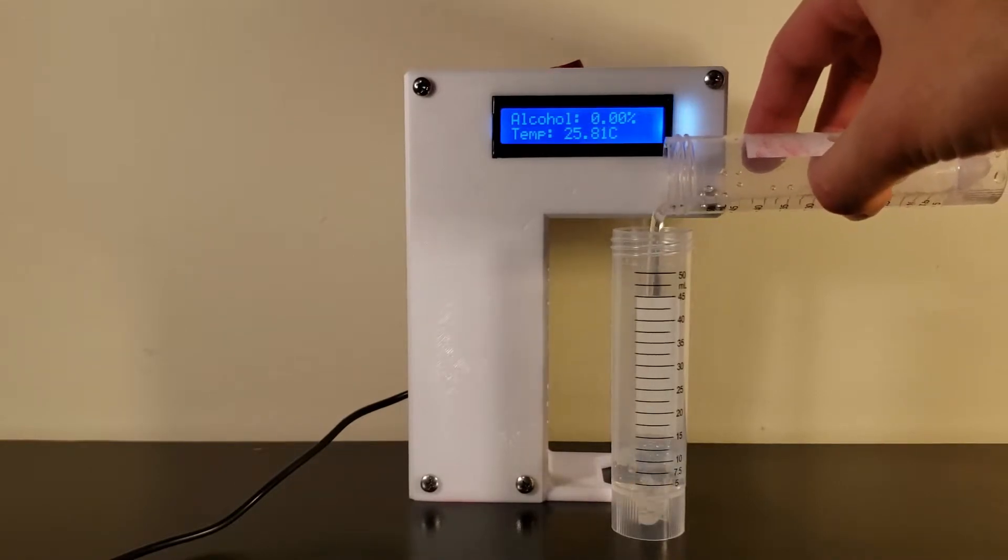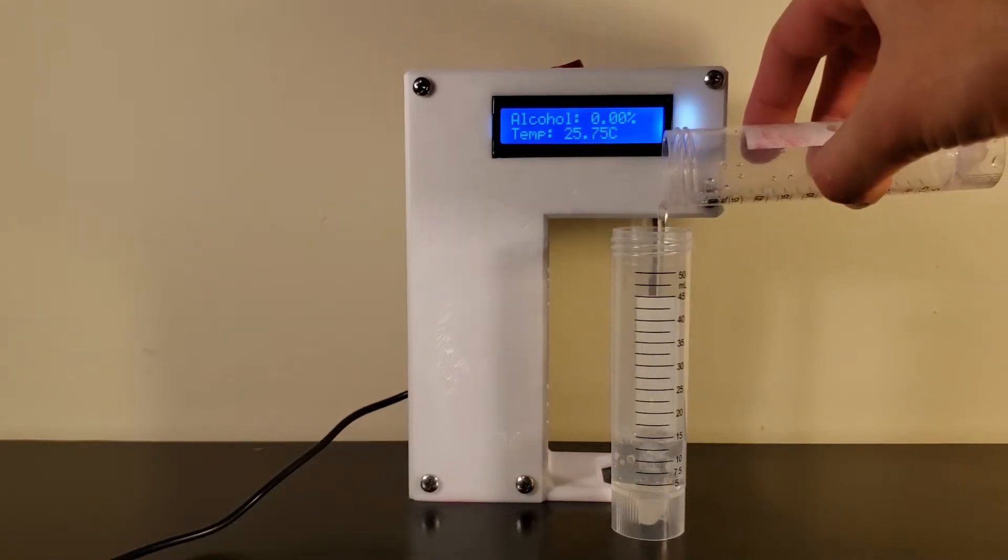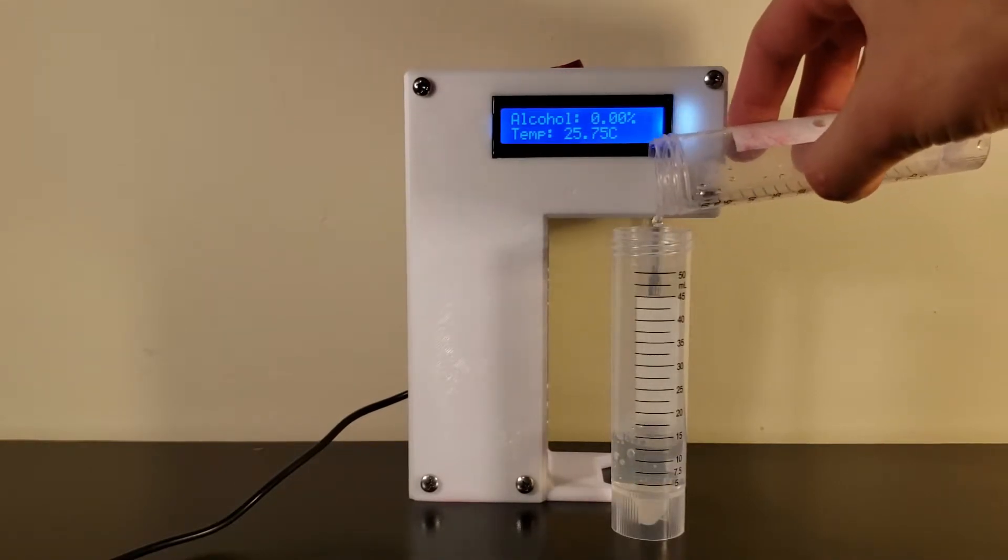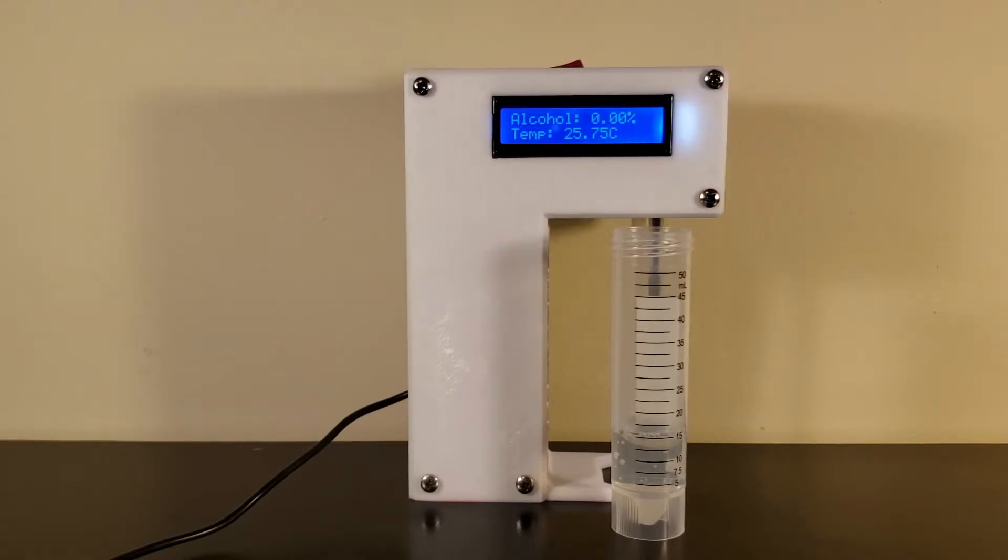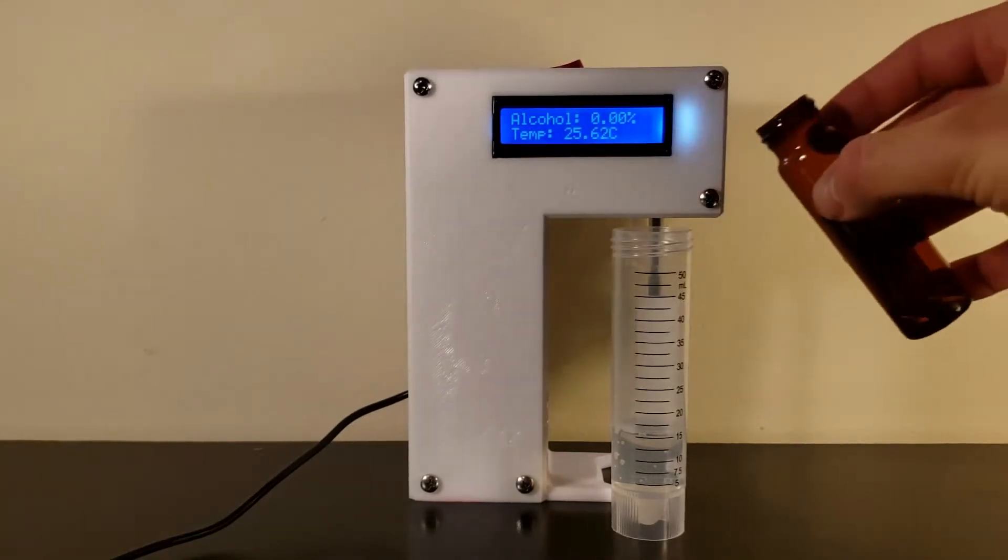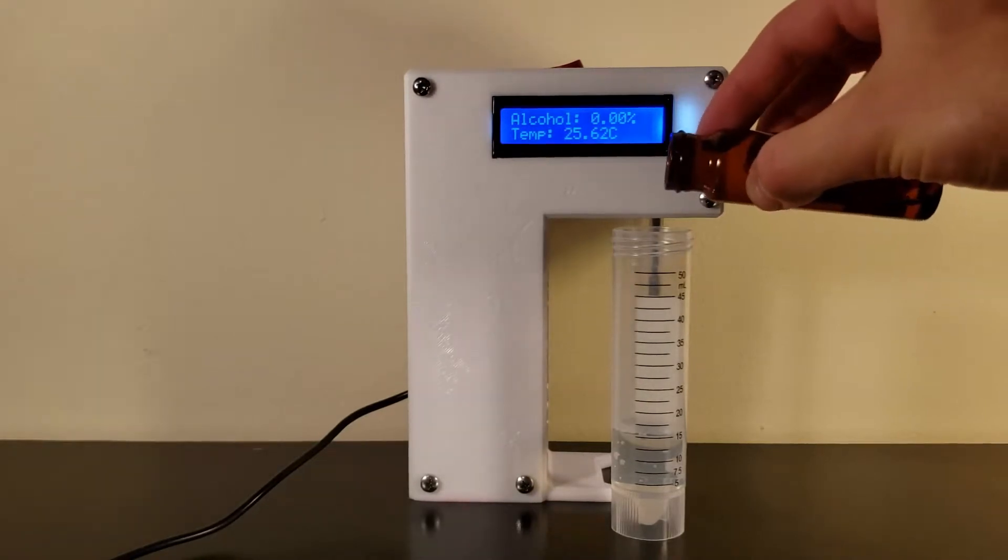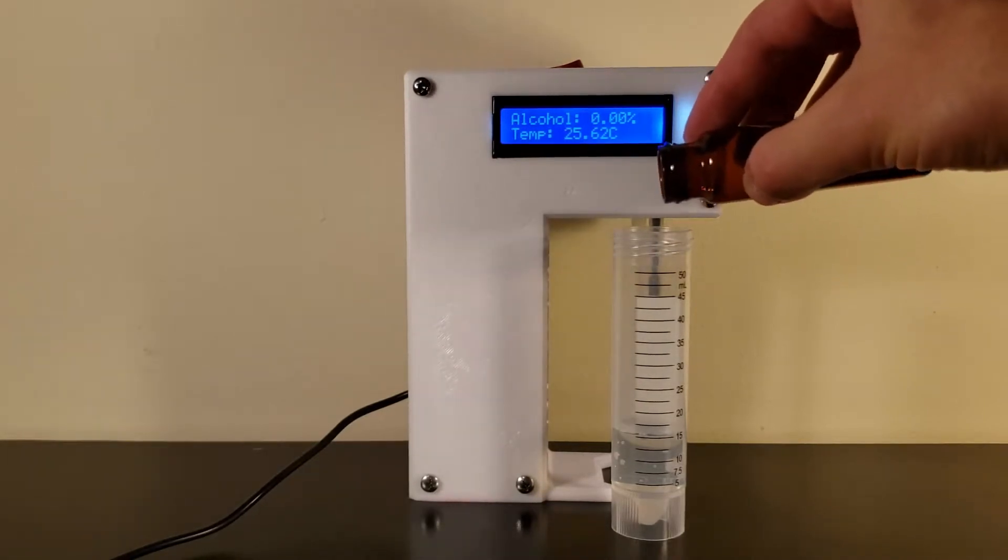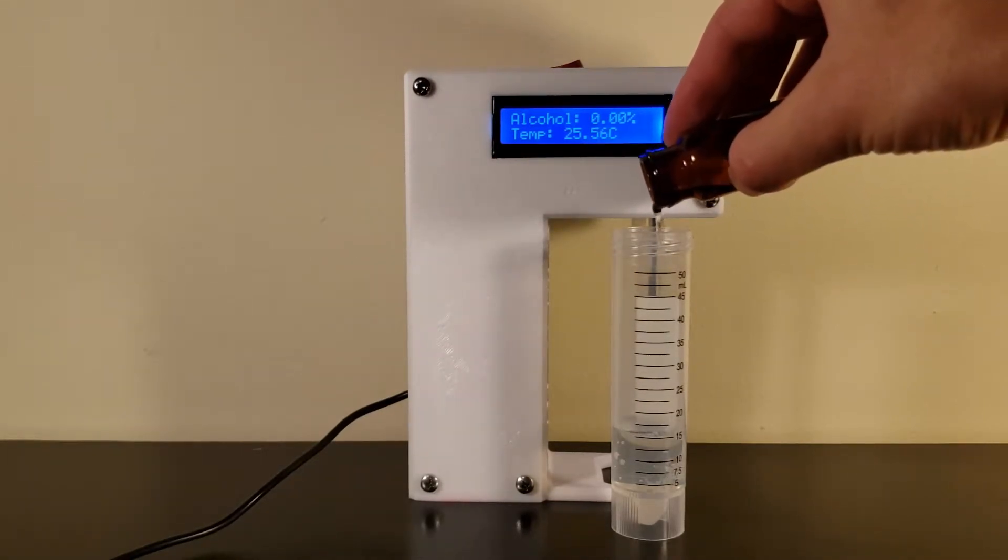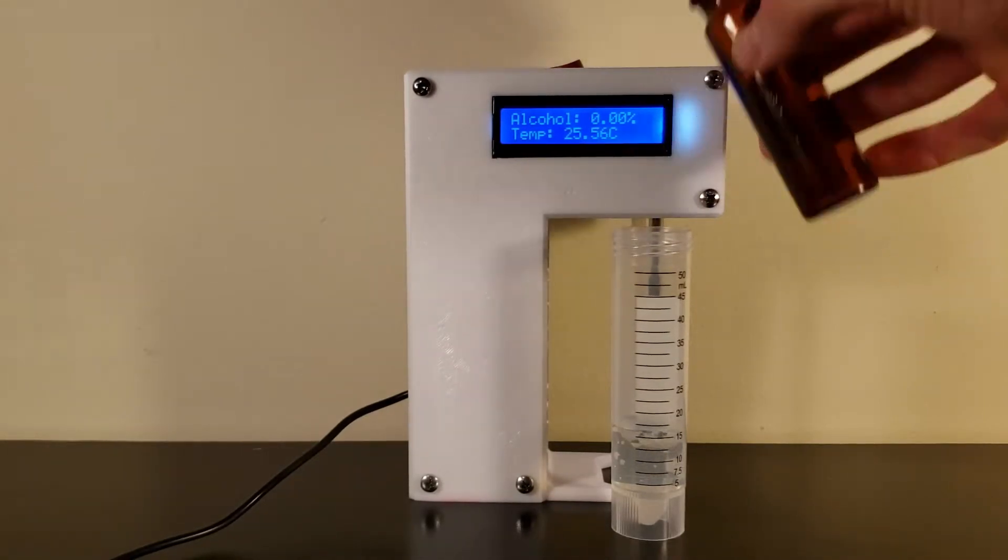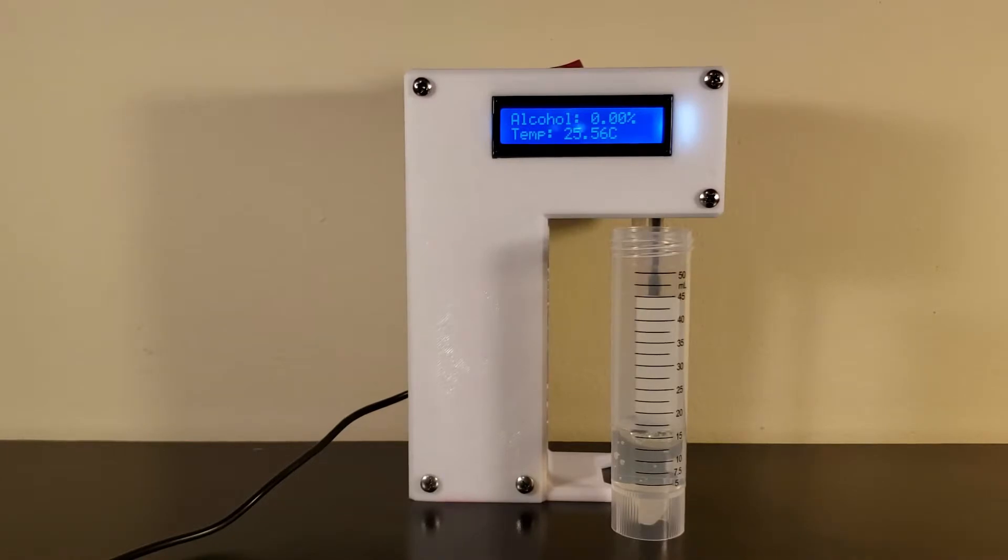In this case, we are testing 0.5% alcohol. One thing to note is that no foam or liquid should be allowed to enter the detector. To prevent this, you can add a drop of anti-foam or a milliliter or two of vegetable oil.